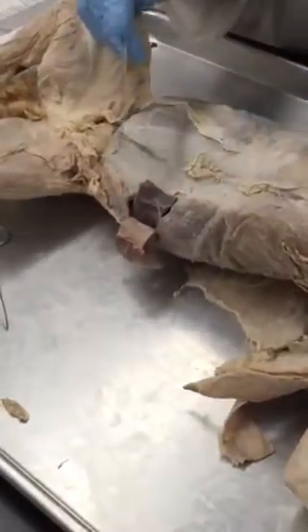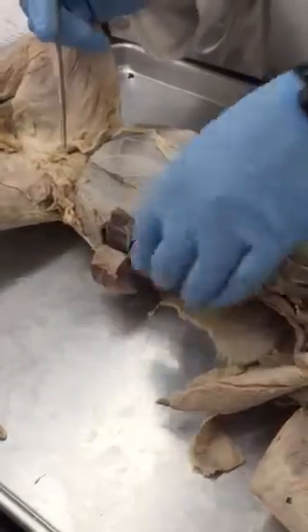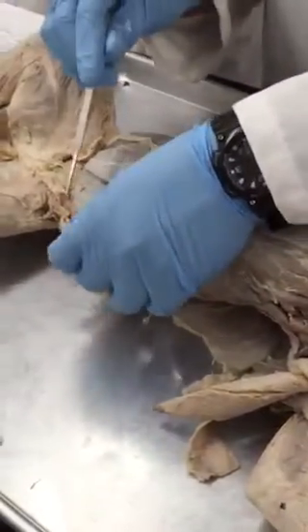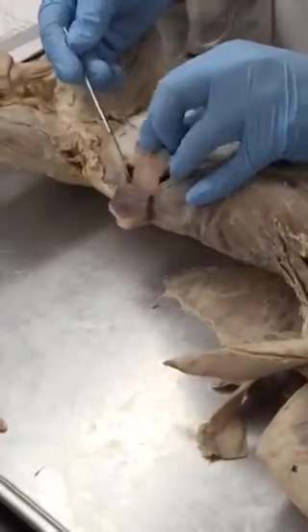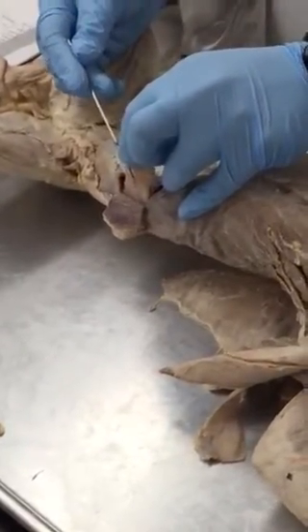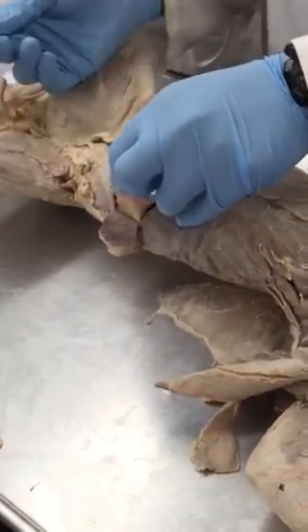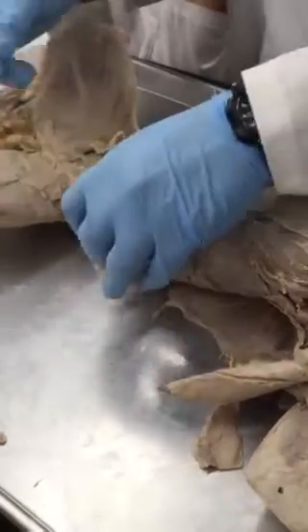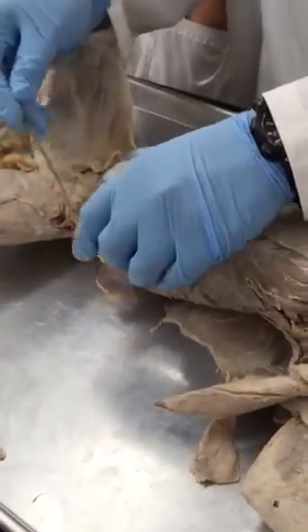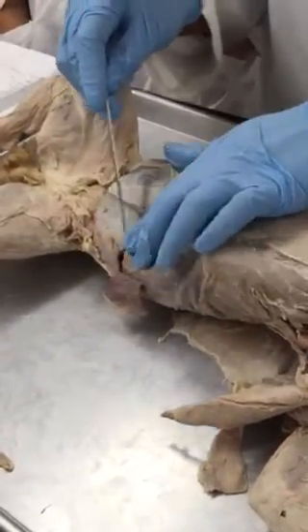Now, the confusion with the video that is posted online was, what they were saying, and they were right actually, is that what you are seeing here is the fascia, or the ligament, that originates from the internal oblique. In this cat, the internal oblique muscle has ended somewhere here, and this is the fascia of internal oblique. The part of the muscle that you are seeing here is actually part of the rectus abdominis.